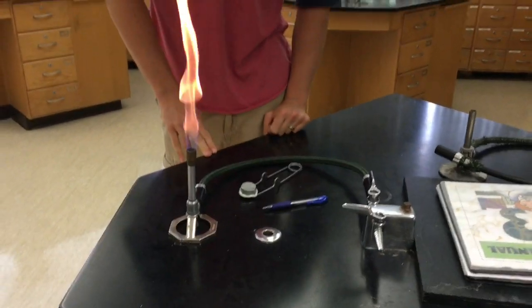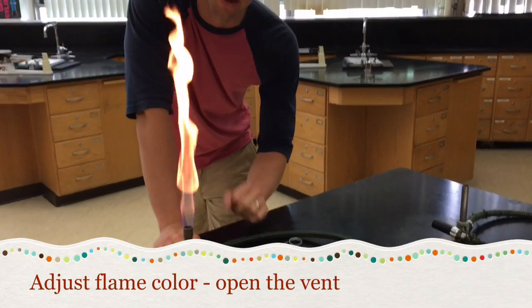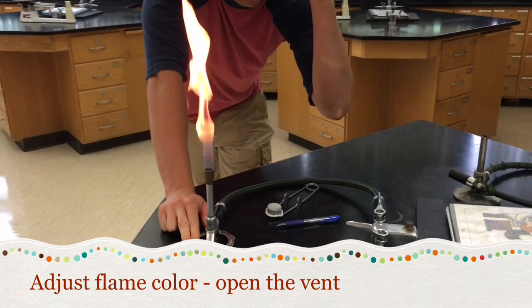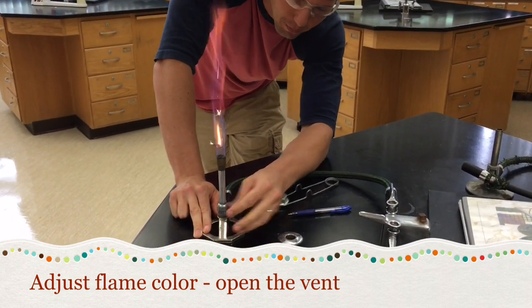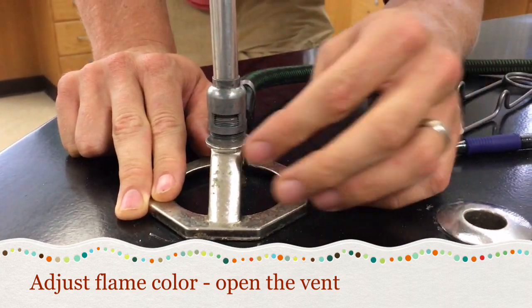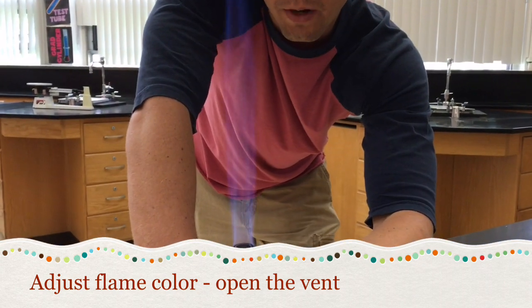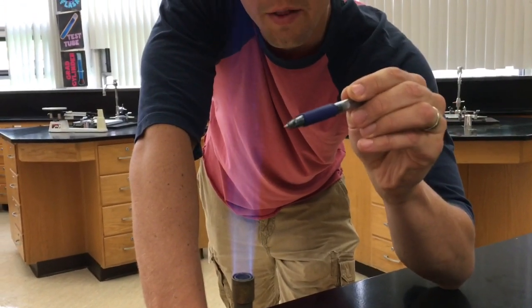This flame, although it looks really cool, is not the kind of flame we're going for — it's too tall and not the right color. First, I'm going to adjust the flame by adding oxygen. I open up the oxygen valve and I'm able to decrease or increase the amount of oxygen coming in. What I'm shooting for is a cone — you can see that cone start to form.